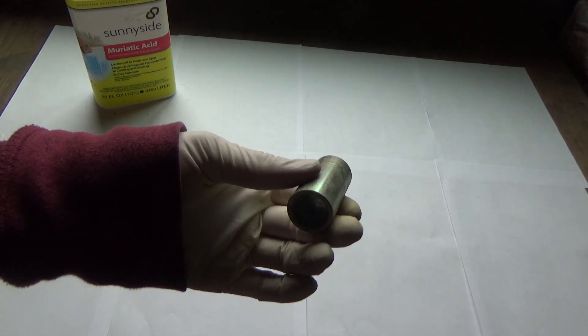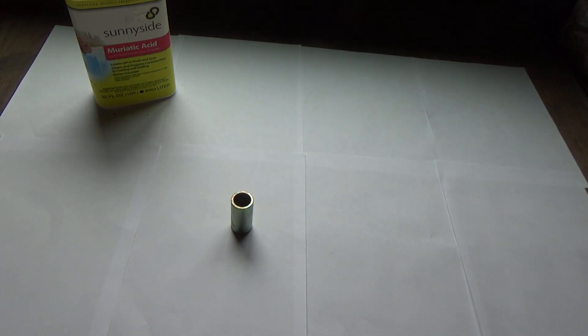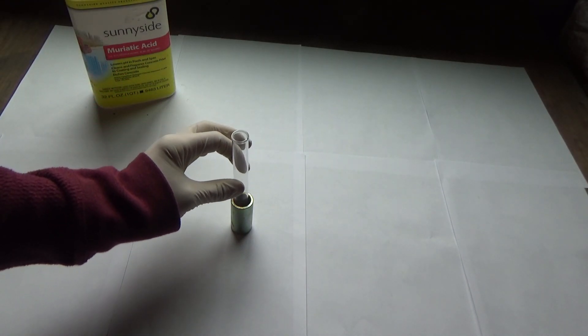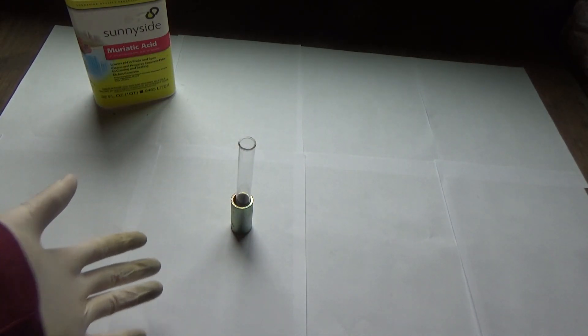So I have this thing right here because I don't have anything to hold my test tubes with yet because I just bought this glassware.